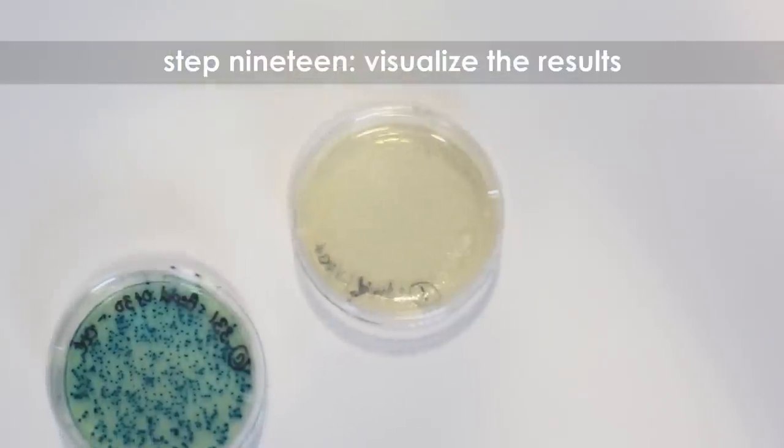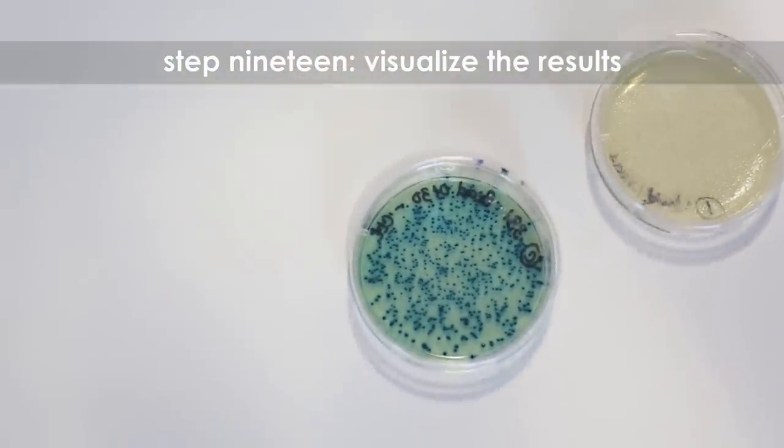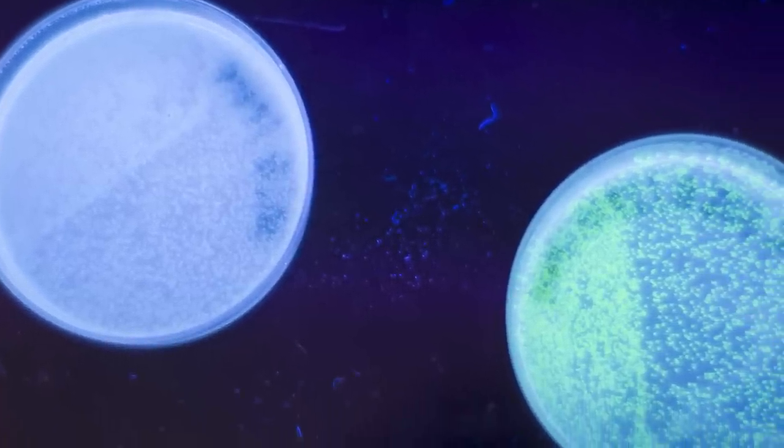Step nineteen: visualize the transformation and control plates. Some experiments require the use of a UV light source.